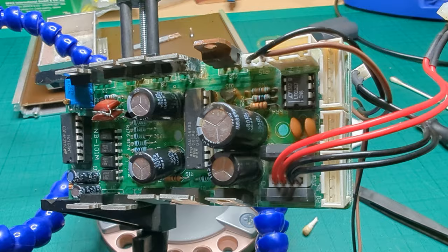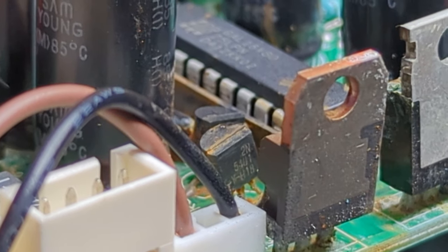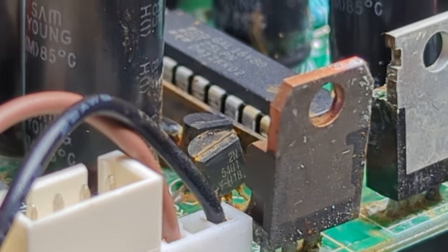On the plus side, all my cleaning paid off. I can see that one of the legs of that transistor is broken and I can see the part number. Now that I've figured out the problem, I need to get rid of that component. And there's a couple of different ways you can do it. The standard way that most people think of is a soldering iron and something like soldering wick. This is copper braided tape and it'll absorb the solder once it's liquid.